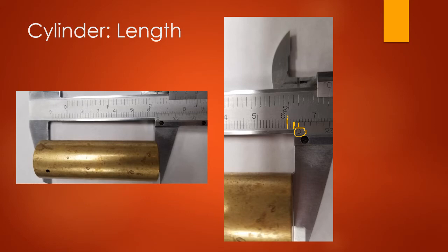So since this caliper ruler goes to the 10th spot, just like the other ruler did, you want to write out to the hundredths. So I would say, since it's almost at the 6.4, but not quite, the measurement I would write down would be 6.39. This last digit is that uncertain digit, so you might have thought it was 6.38 or 6.37. That's fine. The important thing is that you have 3 significant digits that you've went out 2 decimal places.